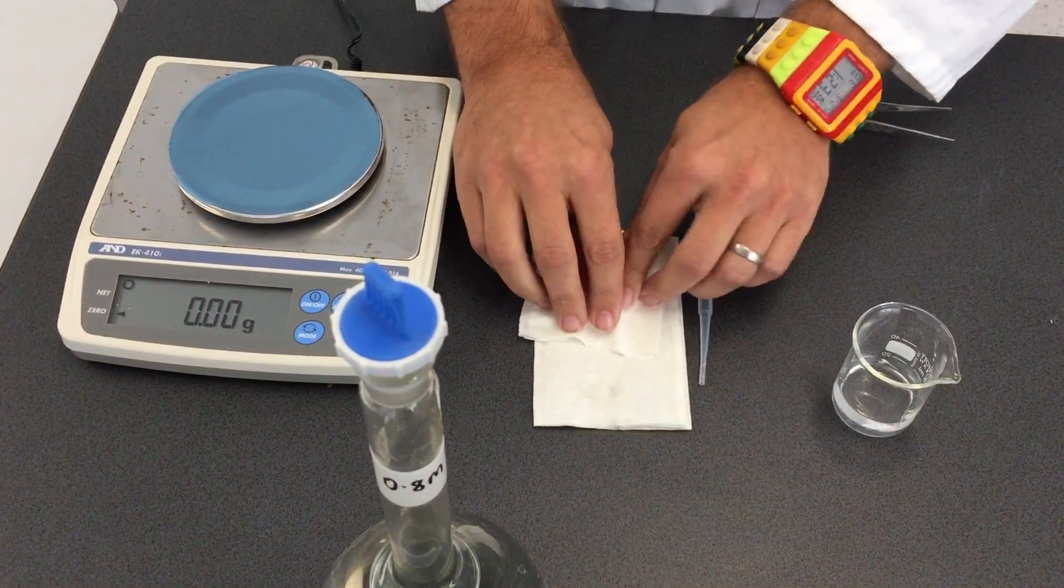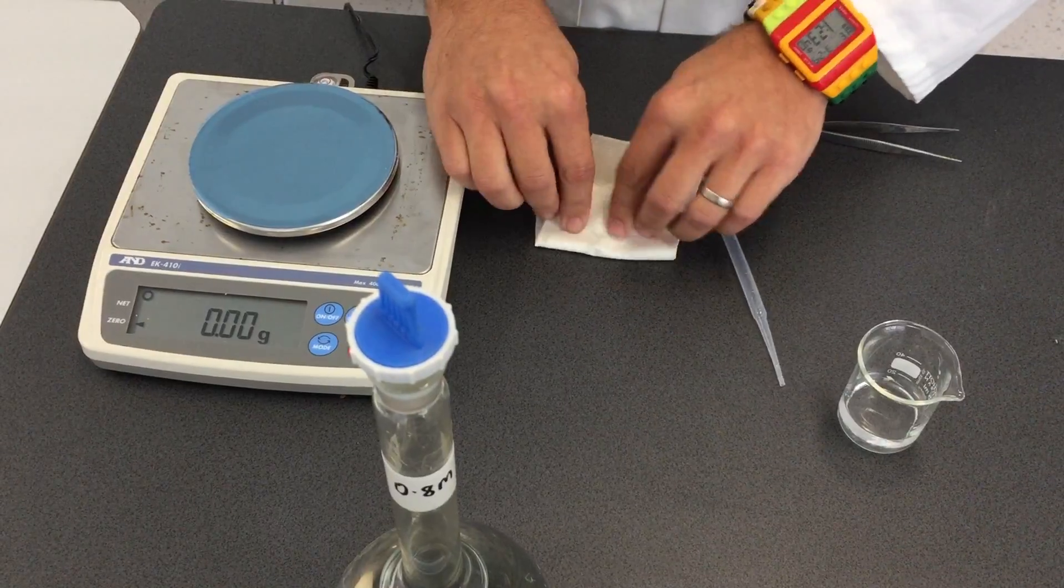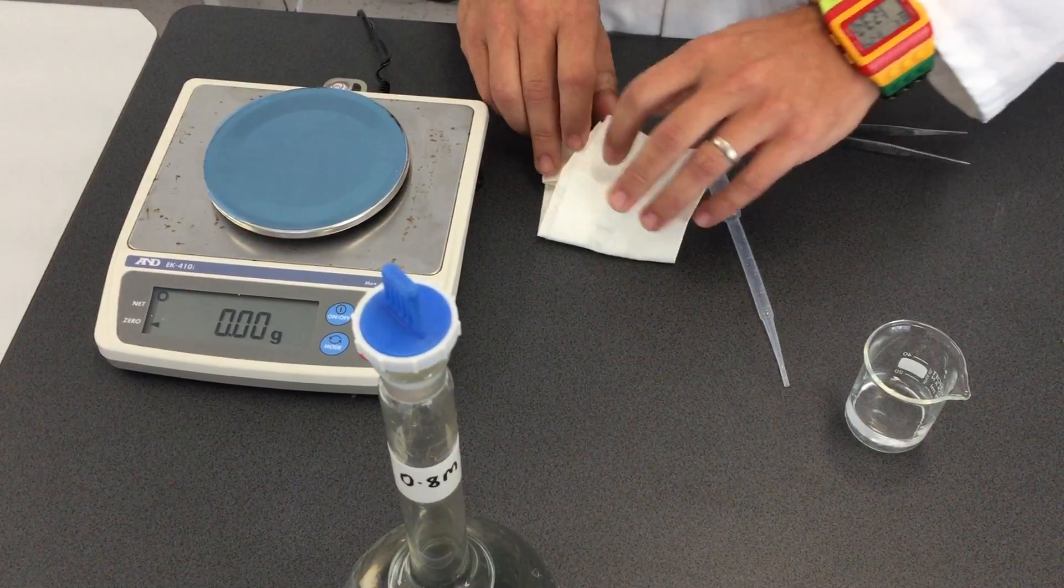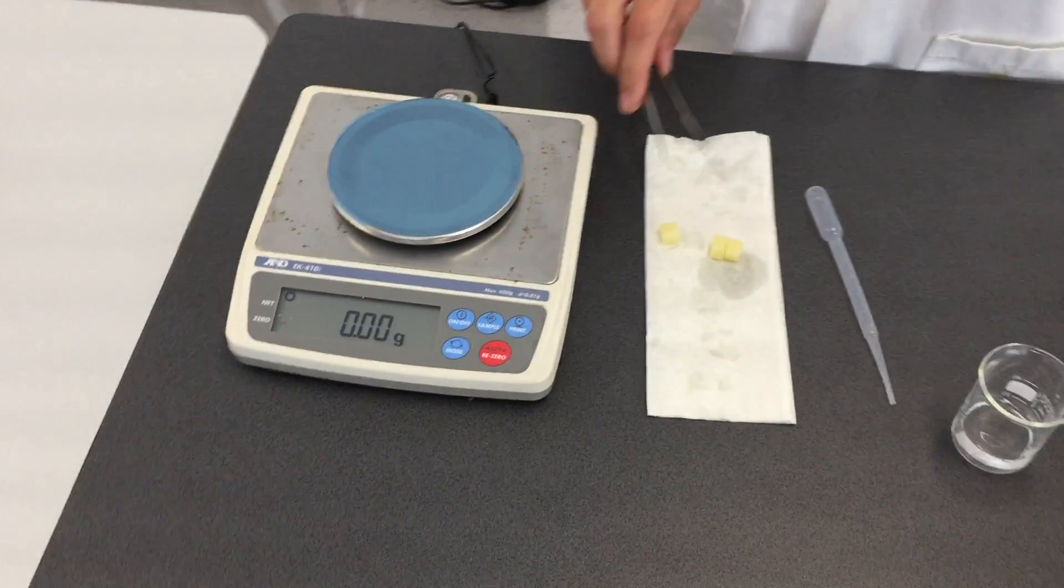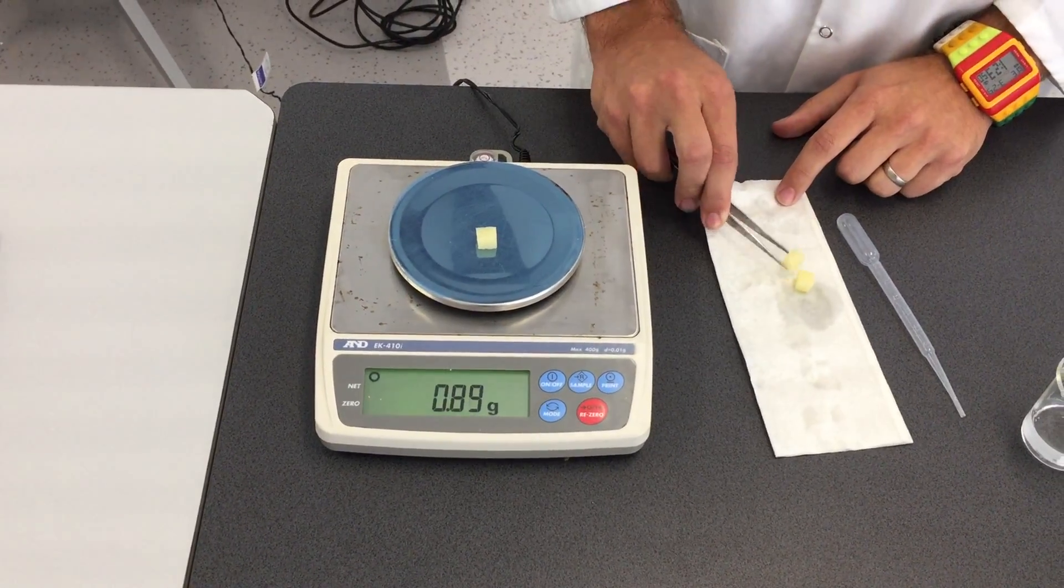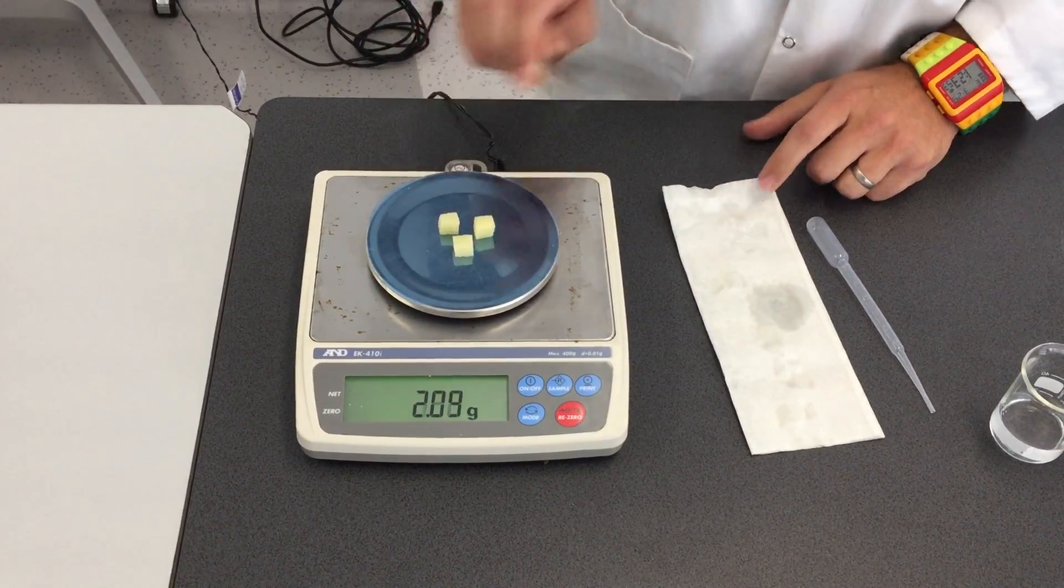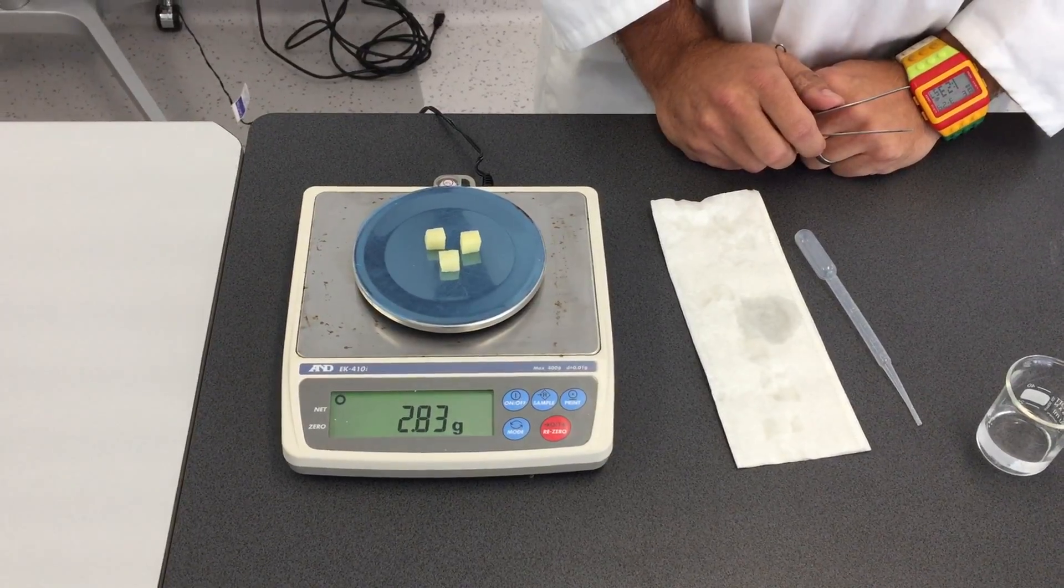Dry them as before, making sure not to press too hard to squeeze out any liquid. Checking that the scale is re-zeroed, we weigh those again. 2.83 grams.